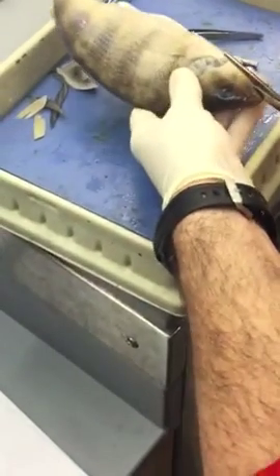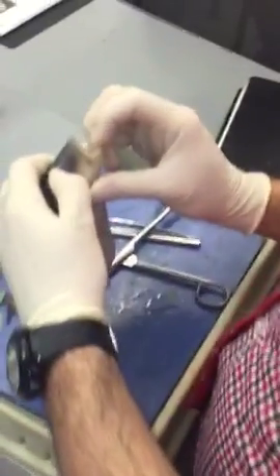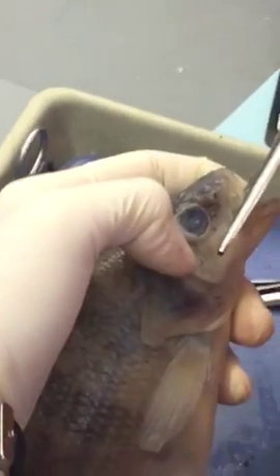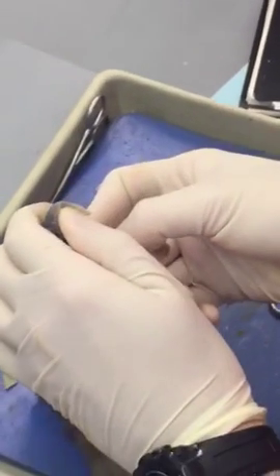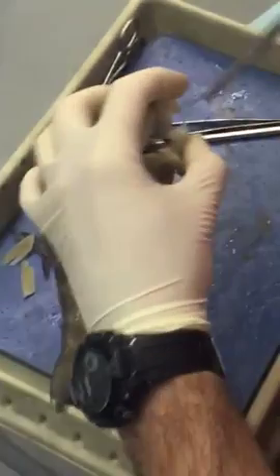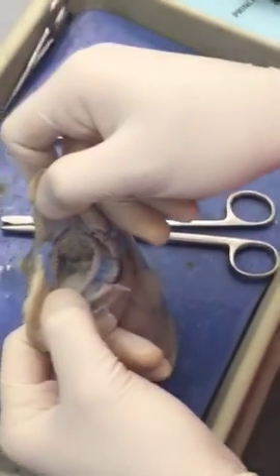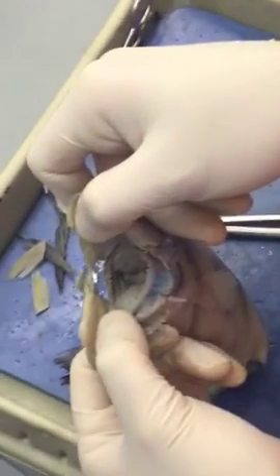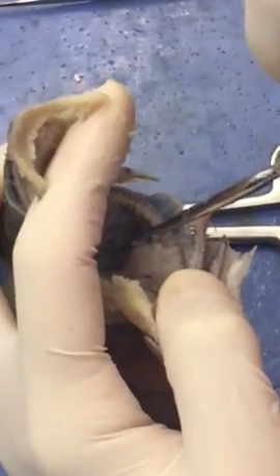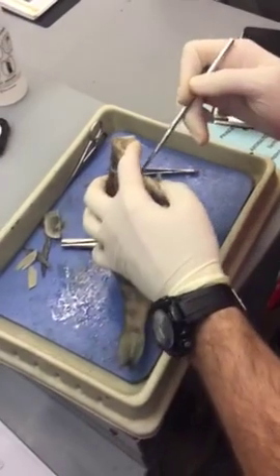What we're going to do right now is I want to make sure you see the buccal valve. Let's actually do the other one. You can see the buccal valve — there's a valve in there. This also gives you a really good view of the gill rakers on either side. See how it's closed — that's the esophagus, you can't just get in there. You can see the buccal valve and the gill rakers on the sides.